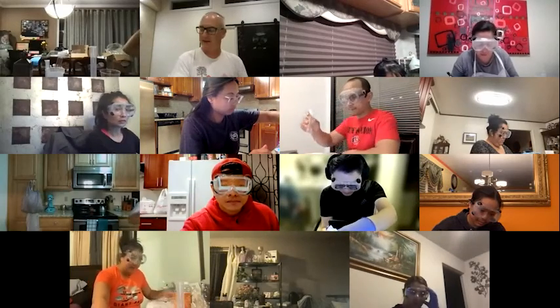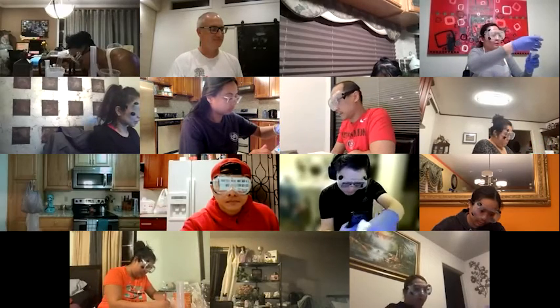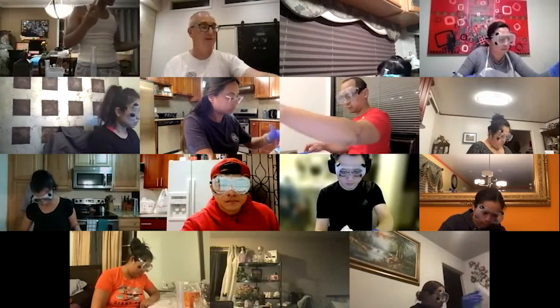Are you wearing your goggles on your forehead, young lady? Sorry, I was going to write something. They're fogging up. Every time I write, it's a pain. I can't see what I'm writing. That's a pain, yeah. Those goggles in particular, because they seal in, they fog up pretty readily. If you just have the glasses, they don't tend to fog up as much, but they don't offer the protection either.